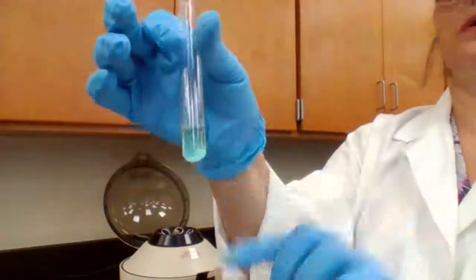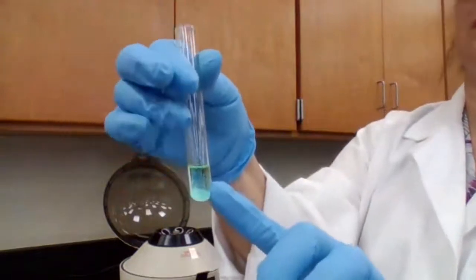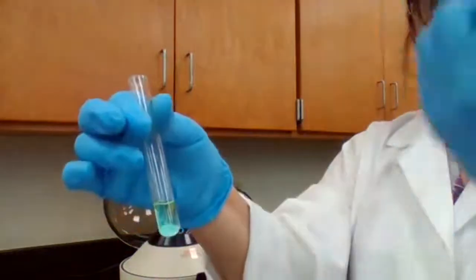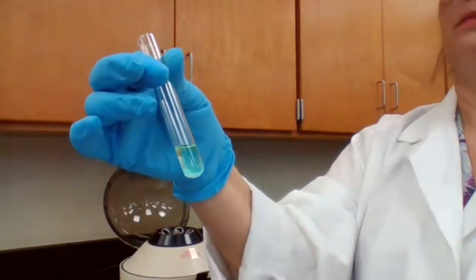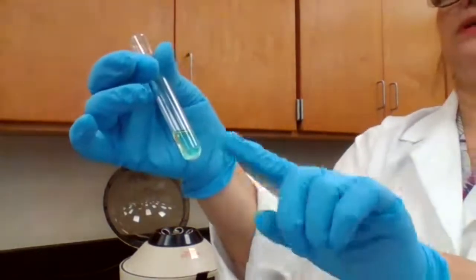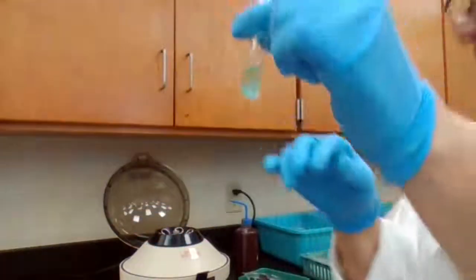In the solution part, there is no silver or lead. If I got additional precipitate, what I do, I have to put it back in the centrifuge and separate, make sure that the white precipitate is settled down completely and only the clear liquid is on top. So no new precipitate forms.